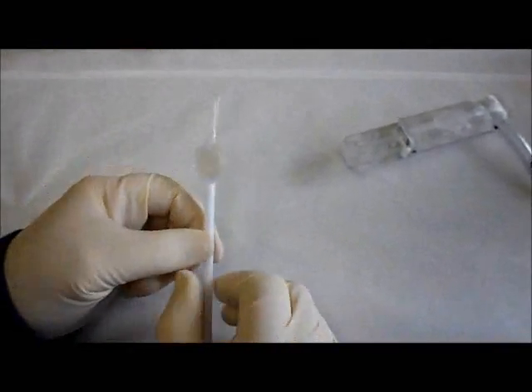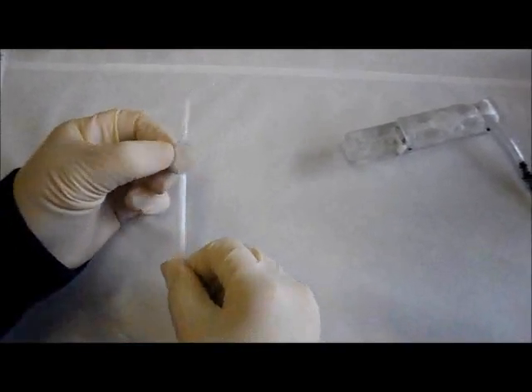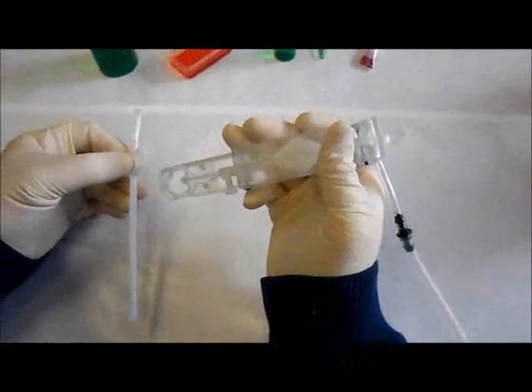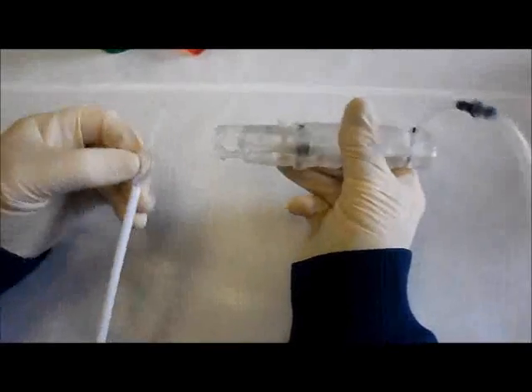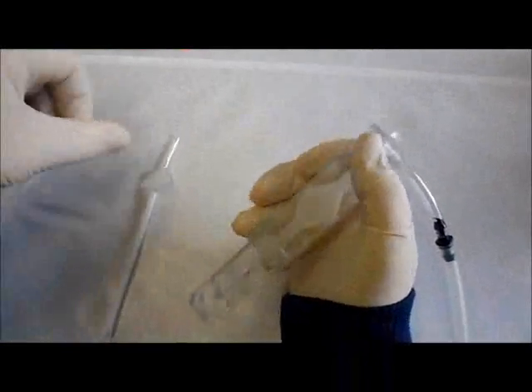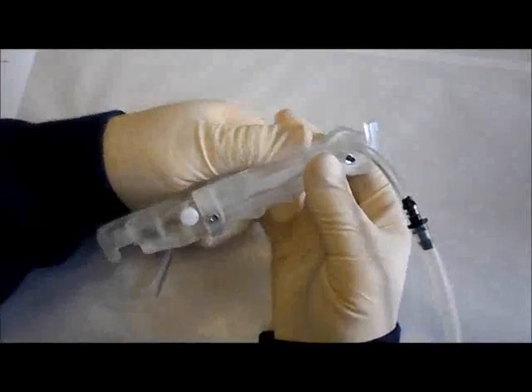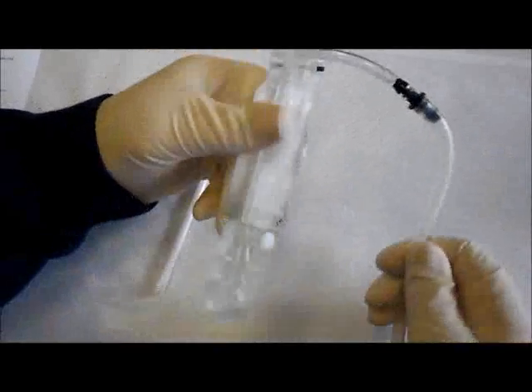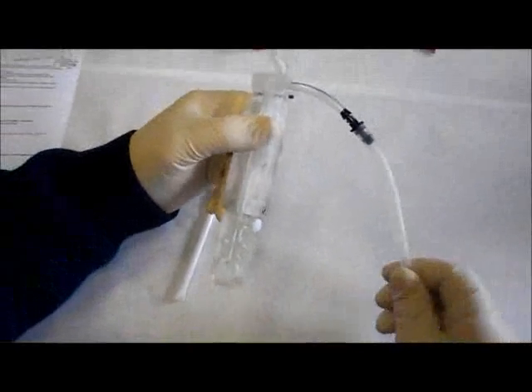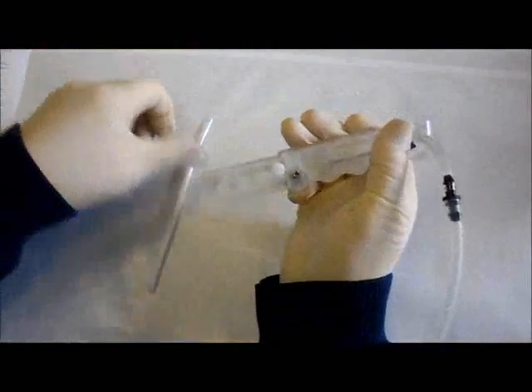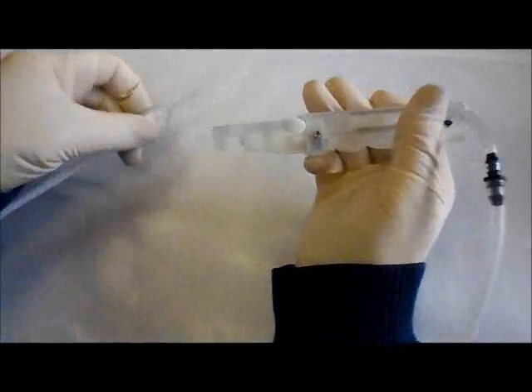In our actual application which I'm going to demonstrate, we have this device in a form which has got protective sheaths on it. The other element that's central to this technology is a suction tool which is going to hold the filtration apparatus. The suction tool has within it lines for vacuum being applied to draw the fluid through the filter cartridge, and the vacuum can come from a pump, a peristaltic pump is what we're using in this case, it can be a lab supply or a tank, it could even be a syringe or a hand pump.